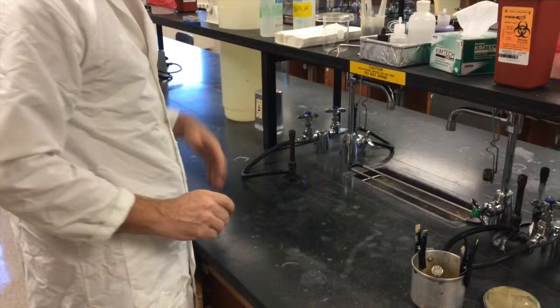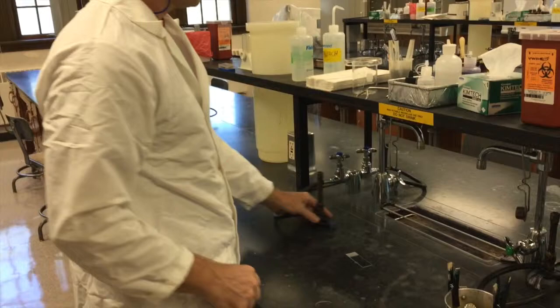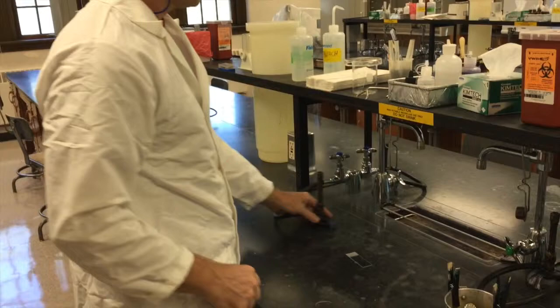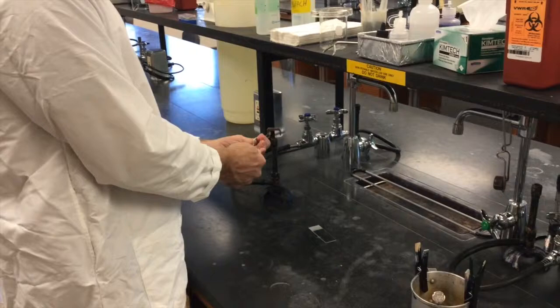And since we're working with flames, and we'll be adding our samples aseptically, you want to make sure you wear safety glasses. Of course, your lab coat's already on. So first thing, when you light your Bunsen burner, this is where you work aseptically. So, light it.